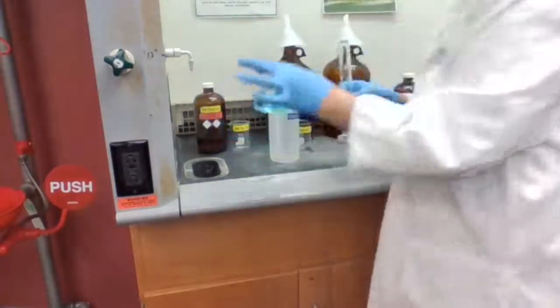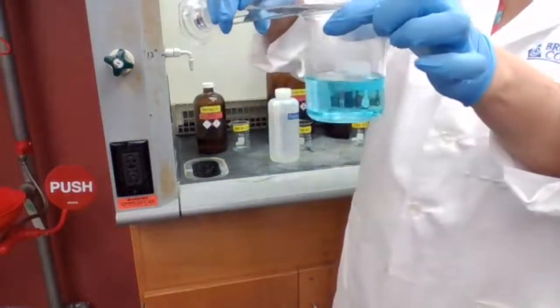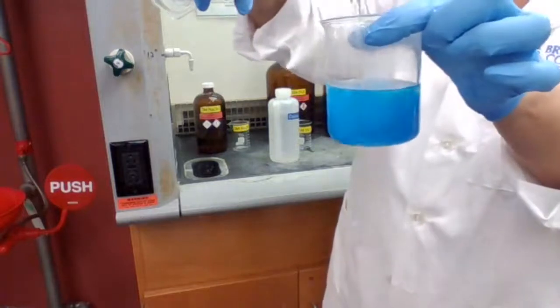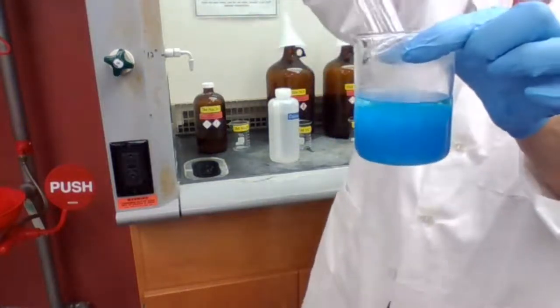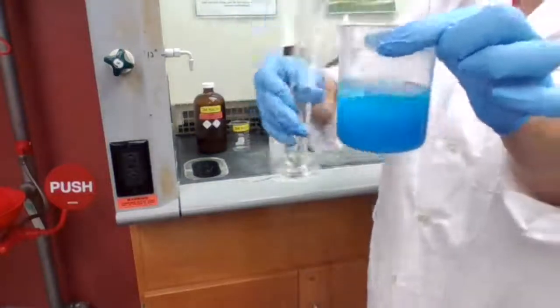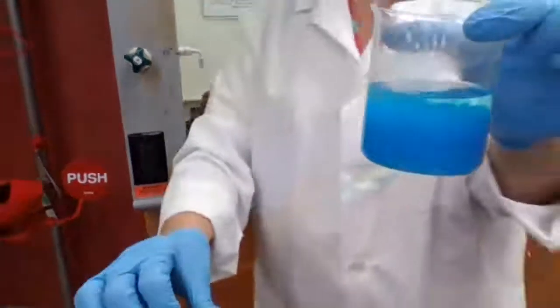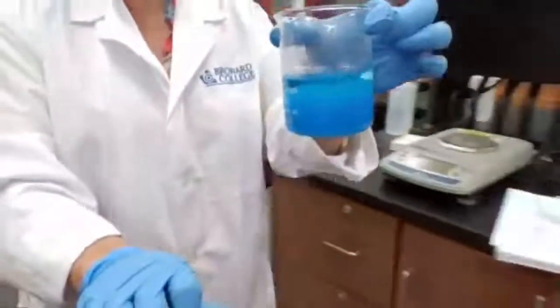By adding sodium hydroxide to the copper nitrate solution, see the color change to a darker color. At the same time, it turns cloudy. What is turning cloudy is actually insoluble copper hydroxide precipitate. So copper hydroxide forms, and it gives that precipitate to you.